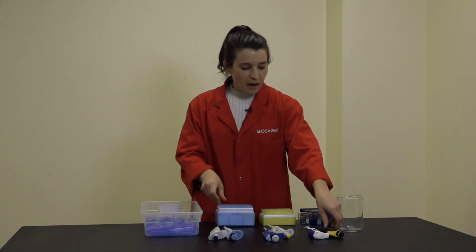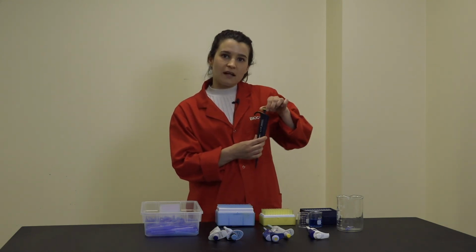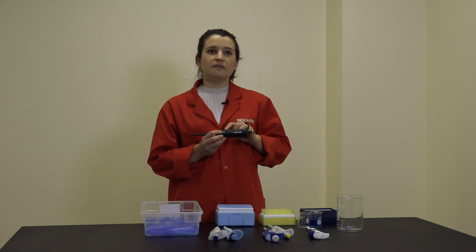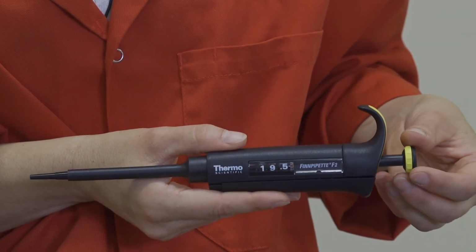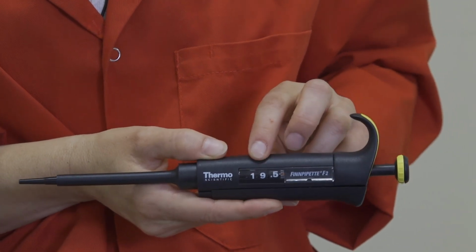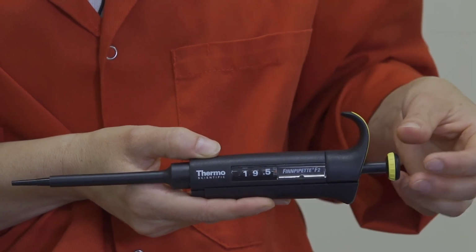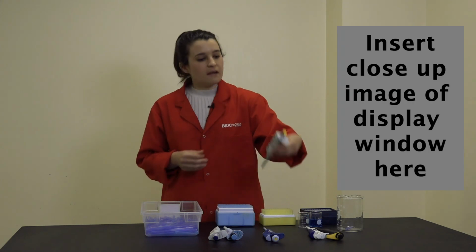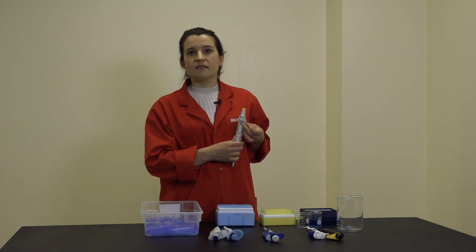You can adjust the pipette volume by simply turning the volume dial at the top of the pipette. When you do this, you need to pay extra attention to the volume display window on the side. Here I have a P20, and you can see that the whole digits and the decimal place are clearly indicated and separated by a decimal point. This particular pipette has the second decimal place indicated by these markings on the far right of the display window. On the other hand, we have a P200 here, which has the whole numbers and first decimal place separated simply by a line.